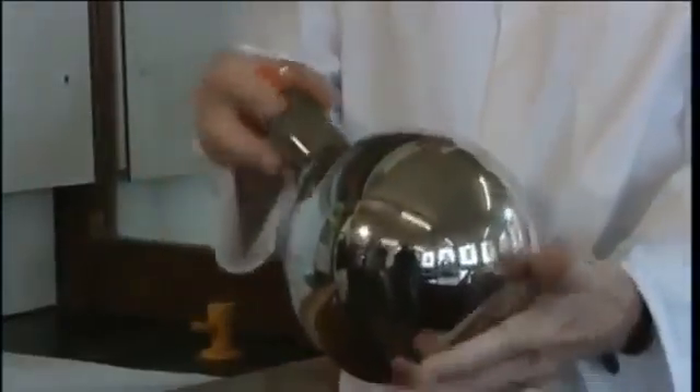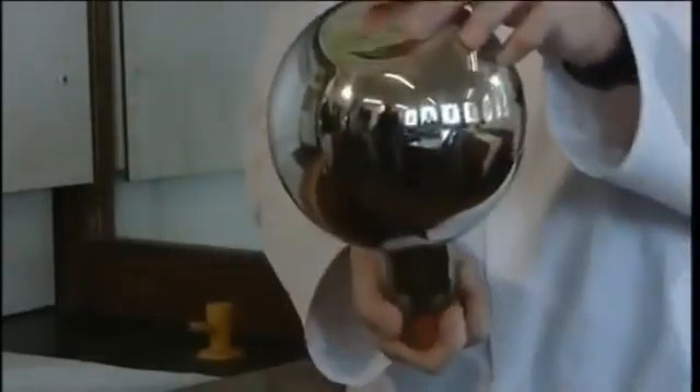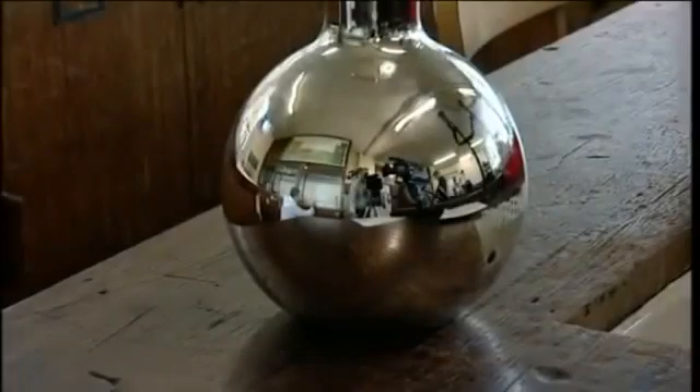The chemistry of this process was actually used in the past to form the silver coating on mirrors and looking glasses — a giant Christmas tree decoration. When you finish this demonstration it's important to dispose of the solution properly.